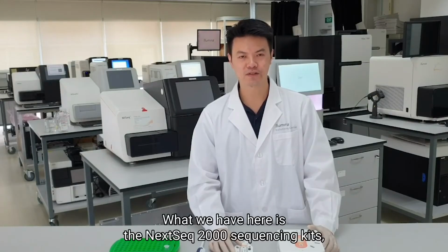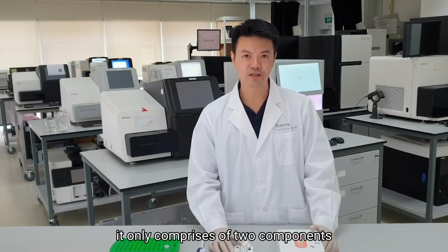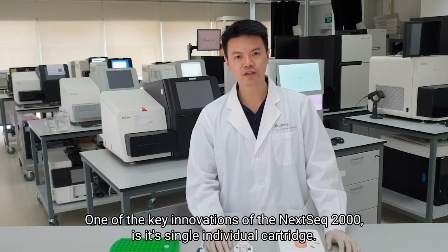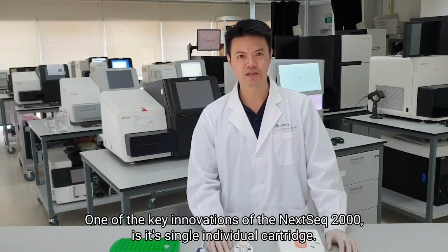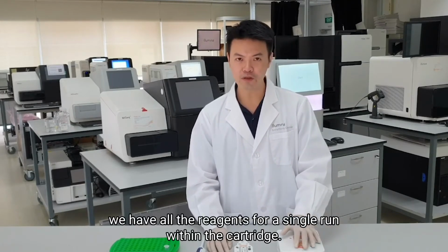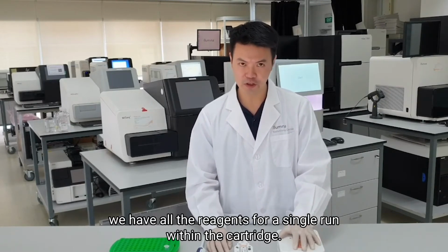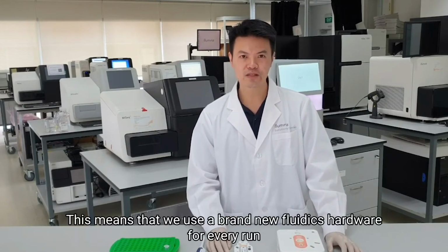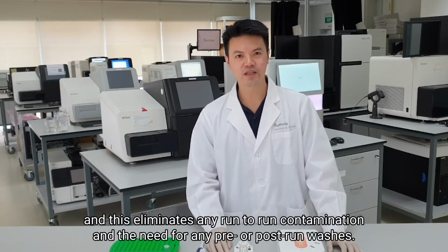What we have here is the NextSeq 2000 sequencing kit. It only comprises of two components, the reagent cartridge and the flow cell. One of the key innovations of the NextSeq 2000 is its single integrated cartridge. What this means is that we have all the reagents needed for a single run within the cartridge. We also have the fluidics hardware integrated in the cartridge. This means that we use a brand new fluidics hardware for every run, and this eliminates any run-to-run contamination and the need for any pre- or post-run washes.